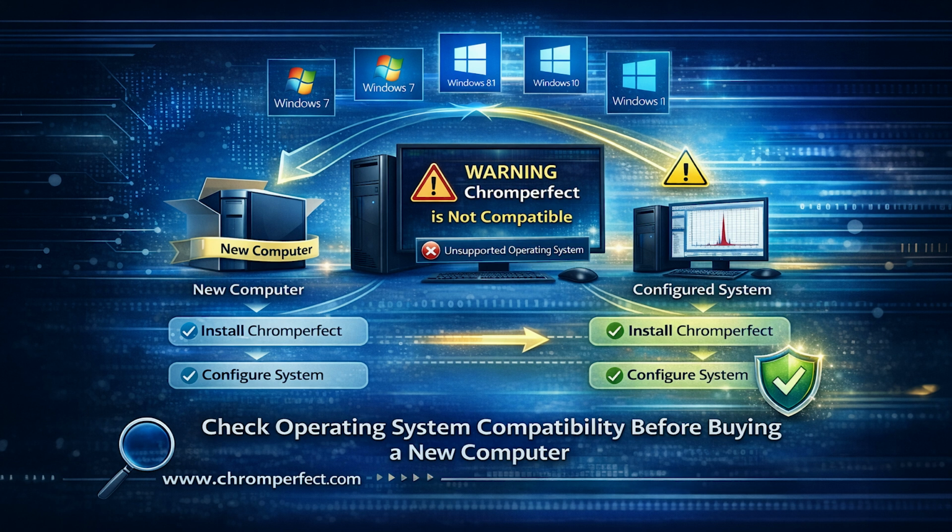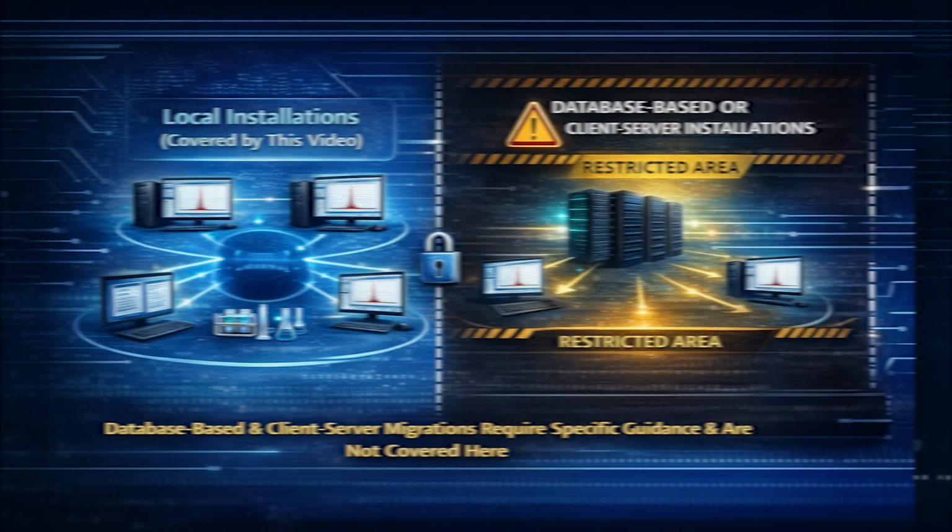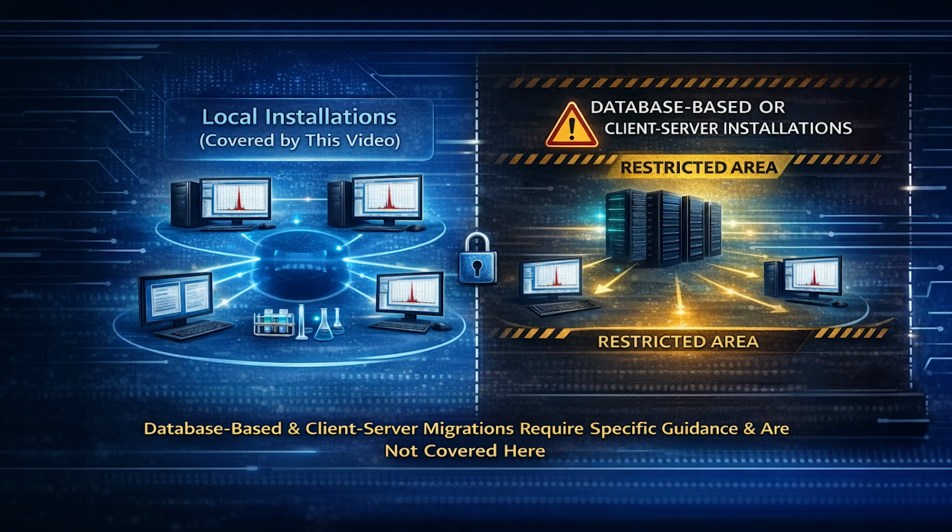For this reason, it is always advisable to check compatibility in advance by visiting the Chromperfect website or contacting Chromperfect staff before replacing hardware. This guidance applies to the core Chromperfect software only. Database-based Chromperfect systems use a completely different migration process and are not covered here.